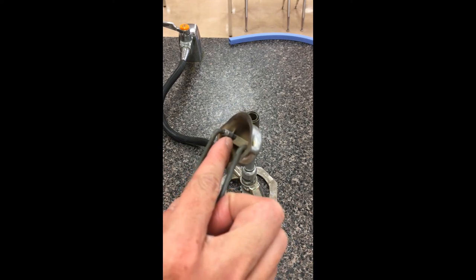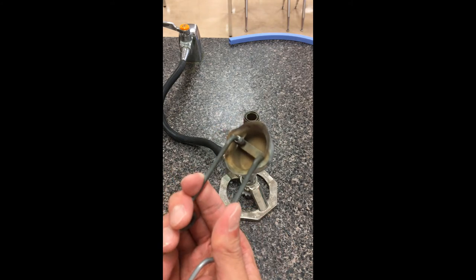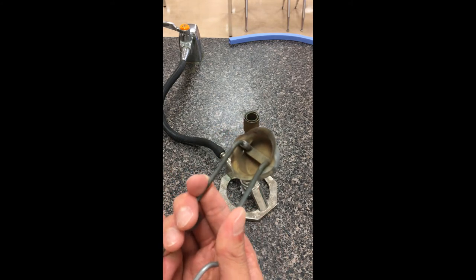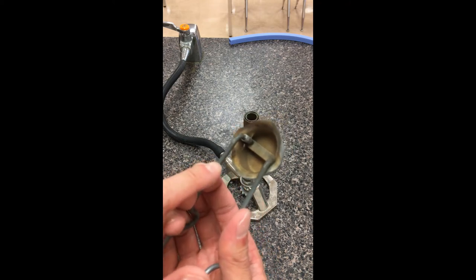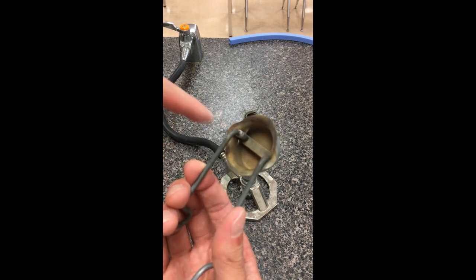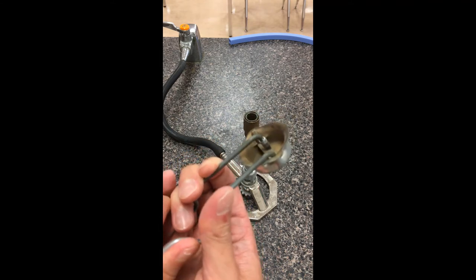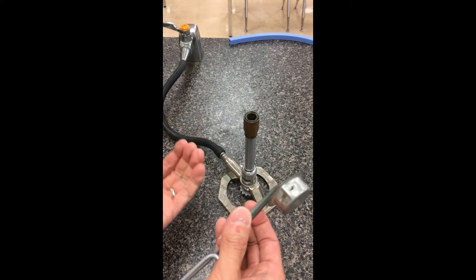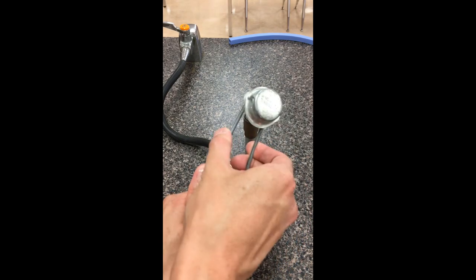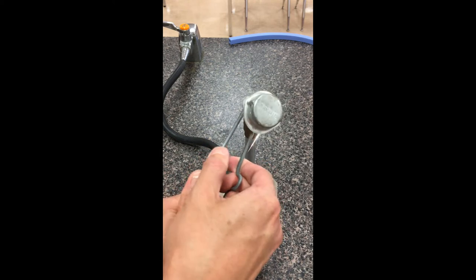As I put the arm back into the metal striker, right now that flint is barely contacting the arm holding the back plate, so if I dial this left to right it's actually not producing any sparks. What's challenging about using these metal strikers is we need to use our fingers, take this arm, and actually push it into the plate itself. We're intentionally scraping the back of the plate — as I pull it to the right, that's going to generate the sparks we need. Because the gas is coming upwards, we're actually going to hold the striker downwards, take the arm holding the rock, scrape it against the back plate, and produce the sparks we need.